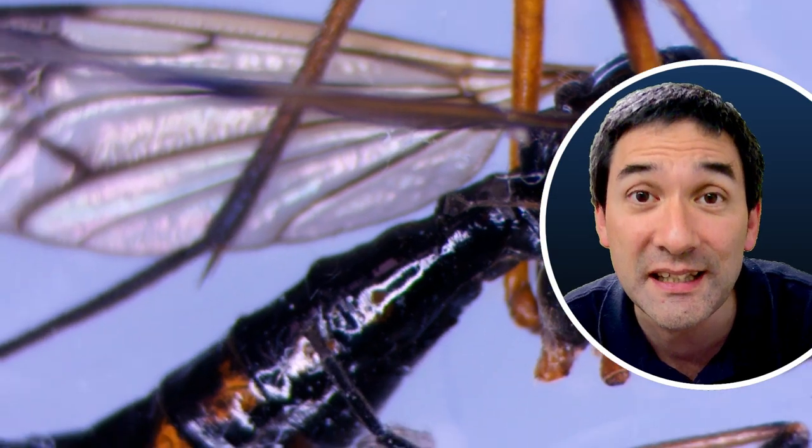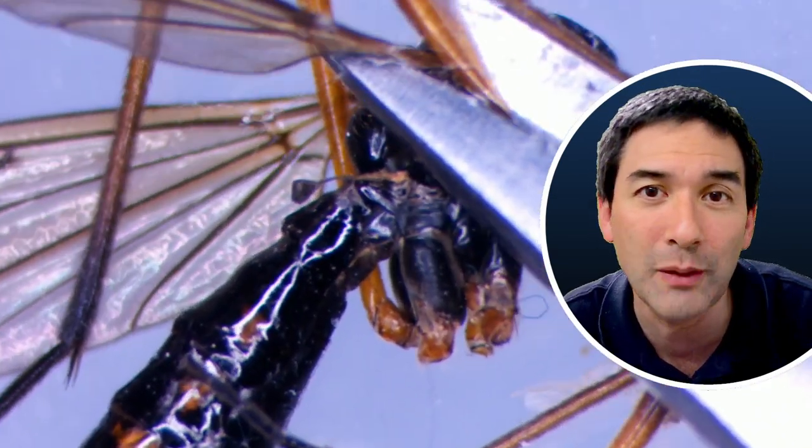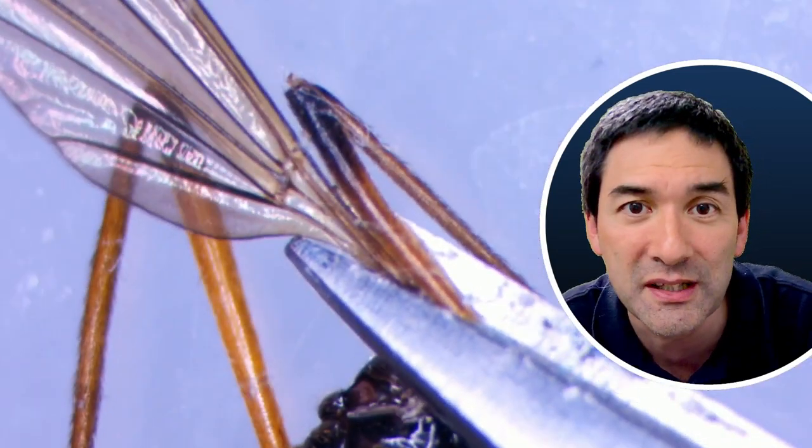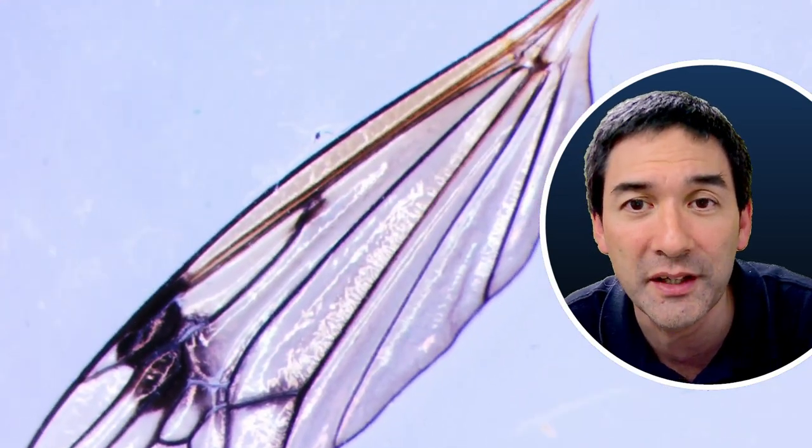Now I found this dead insect on my windowsill and I said, well, beautiful wings, so let's try to also make a permanently mounted slide of those wings. The specimen is quite different; in this case the specimen is quite dry.